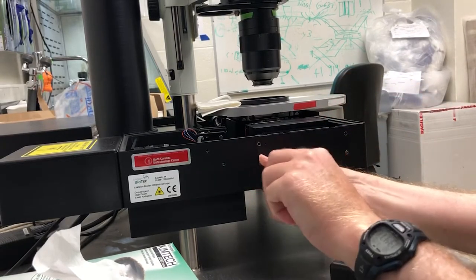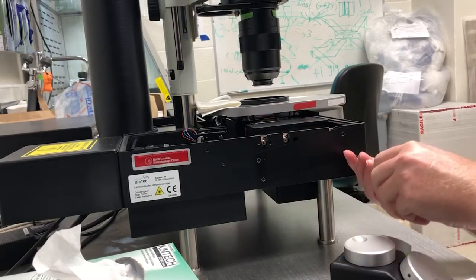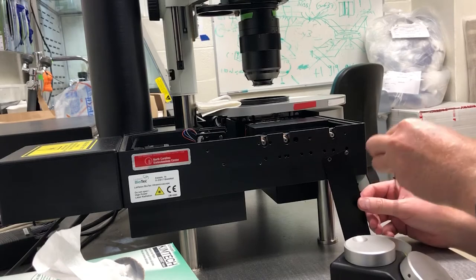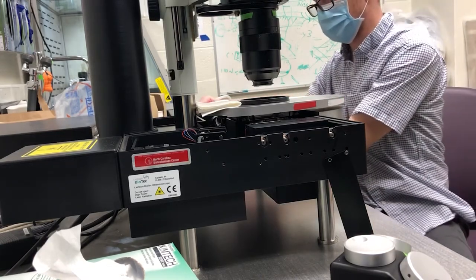There are a few other things I need to move out of the way. For this plate, I use the number two key and remove three of the screws so that I have access to some of the alignment screws for the system. I'm going to remove these three, do something very similar on the other side, and then show you what this looks like from the top.